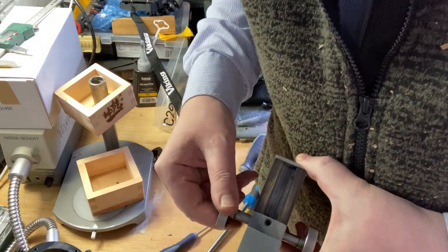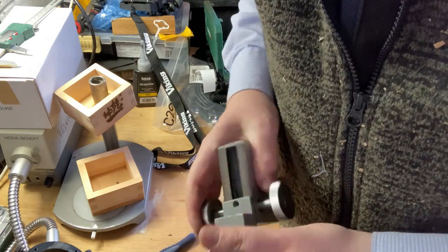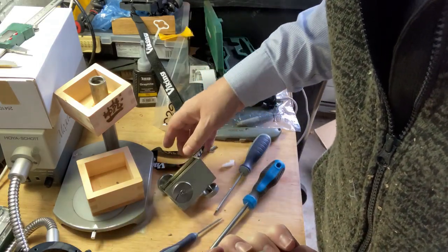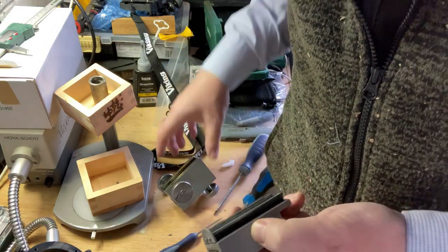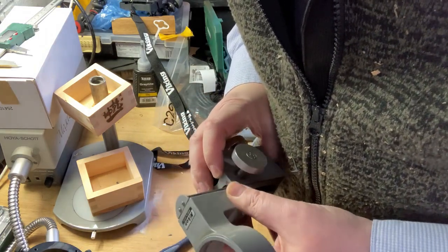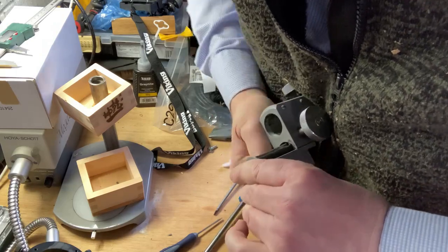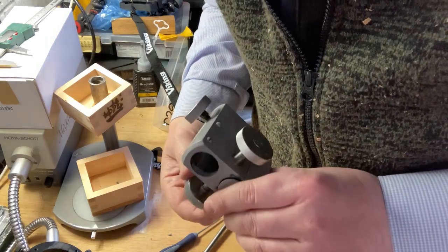Oh, have I got it the wrong way around? No, I've got it the right way around. It's not catching. Or should it be the other way? No, it should be this way. Maybe I just need to add more pressure to it. Yeah, that's it. So I just had to add more pressure to the back.